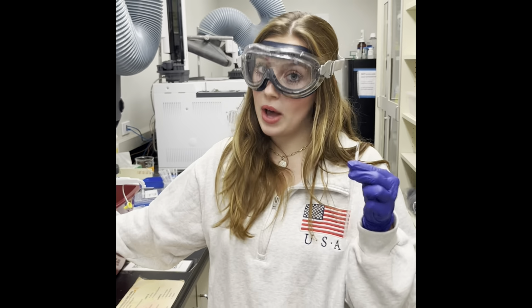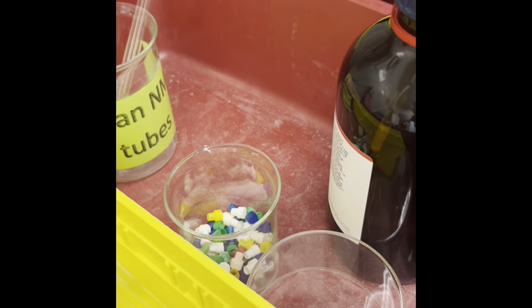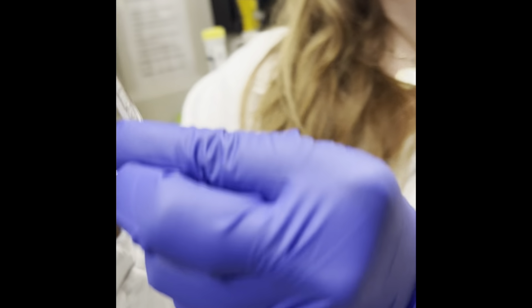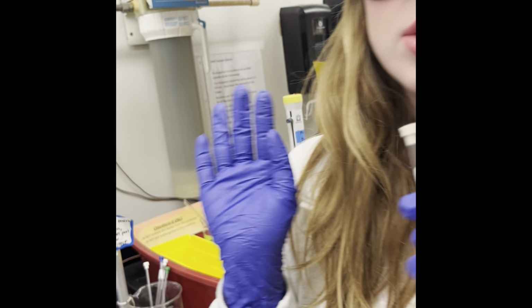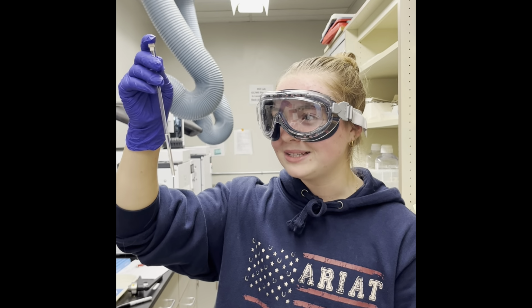When you have your sample at the correct level, you can go ahead and reach into the beaker to grab a clean NMR cap and then go ahead and cap the tube of your sample. Just make sure to put the cap on carefully so you don't accidentally break your tube. Should I shake it or mix it to make sure my sample dissolves?